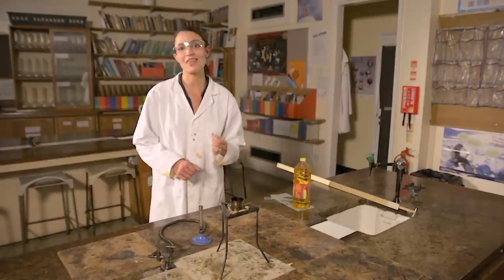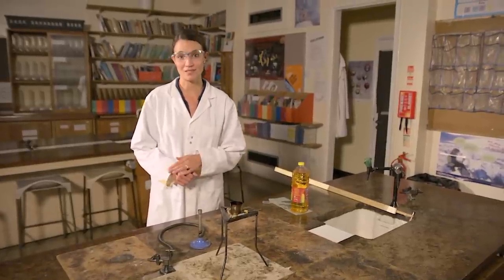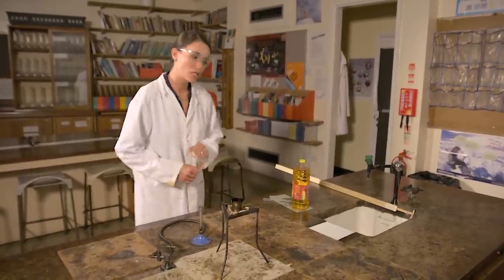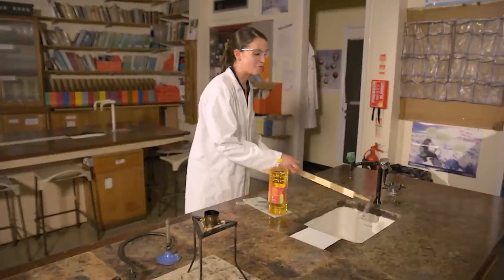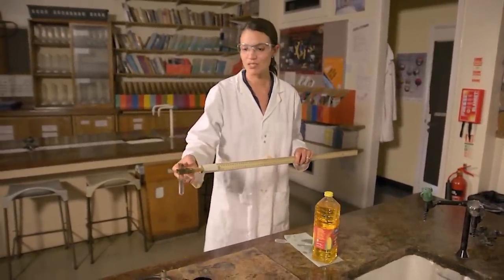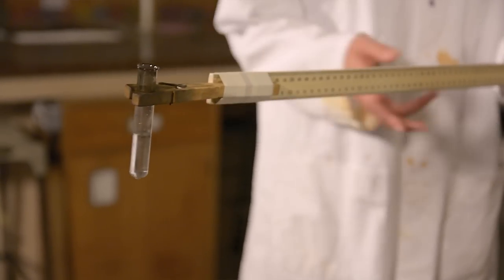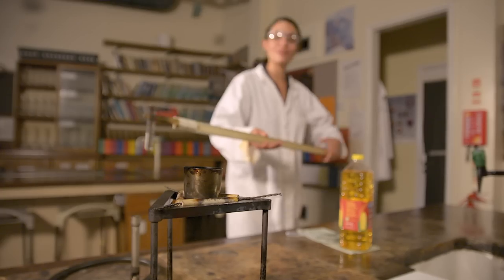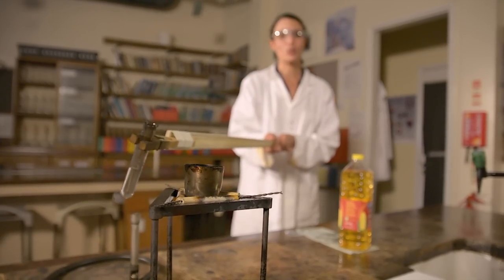I've asked CLEAPSS about this and their advice is to use a four meter safety zone. You'll also need a test tube containing five milliliters of water attached to something a bit like this contraption. This is just a test tube holder taped to a meter stick. This means you can stand a safe distance away when you add the water to the crucible.